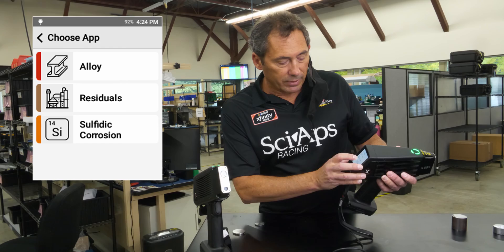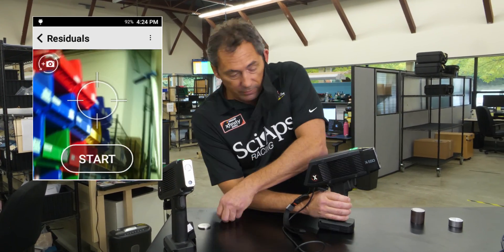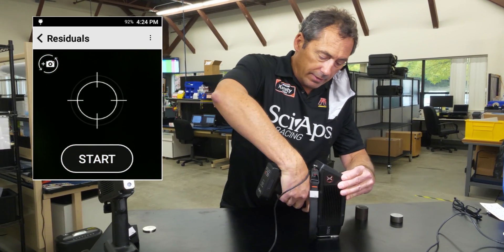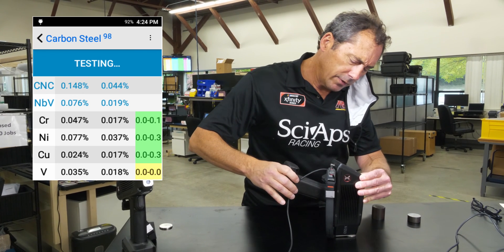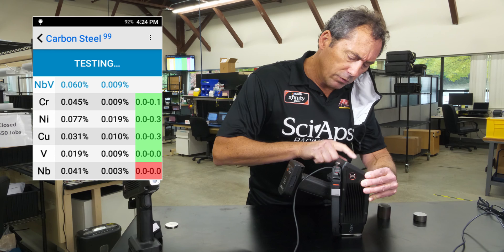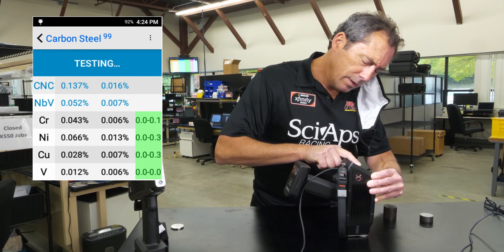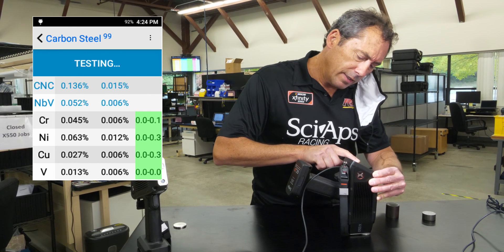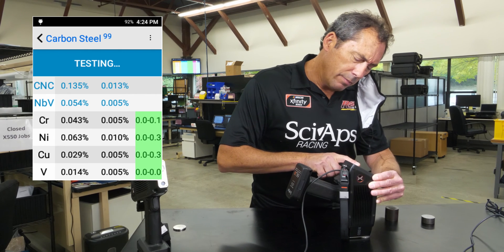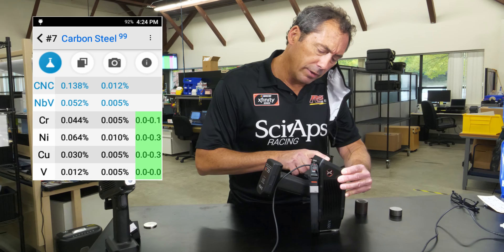Let's do some residuals first. Take a simple, quick sample and put it down here — not to ignore my radiation safety training. After a few seconds, you're getting your copper, your chrome, nickel, vanadium. We'll scroll up to that niobium, and it also tells you your CNC value. It sums them up to about 0.14%. So this would pass on chrome, nickel, copper. You can see it will fail the 0.03 threshold on niobium plus vanadium.